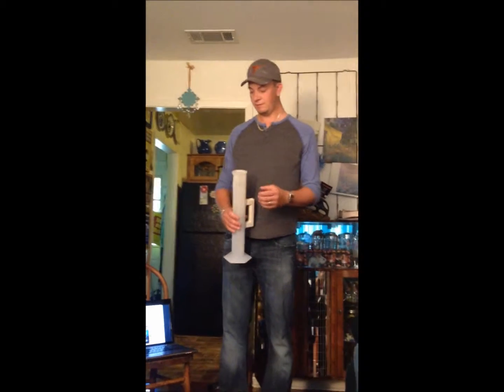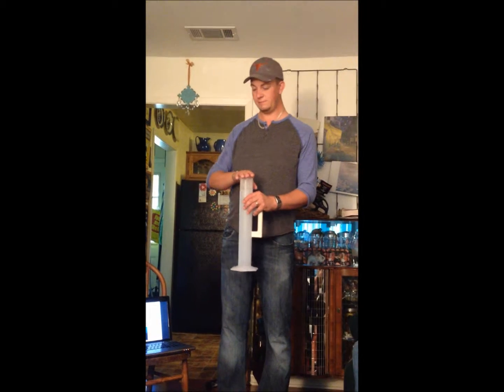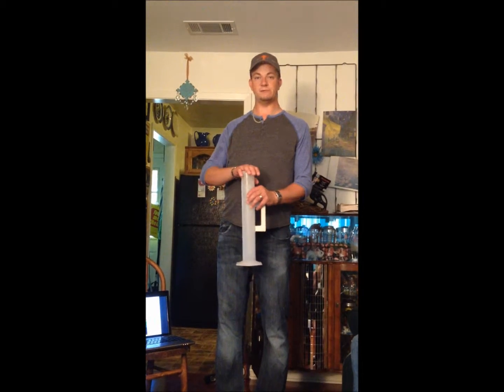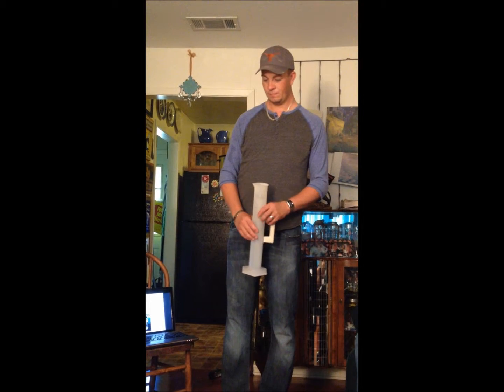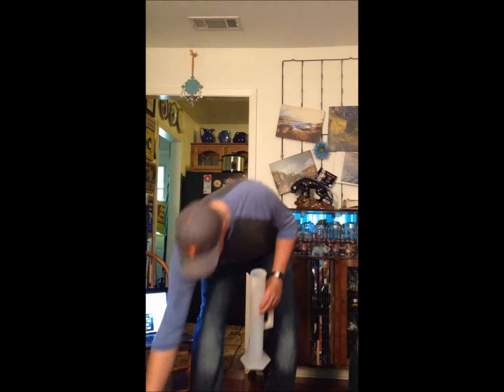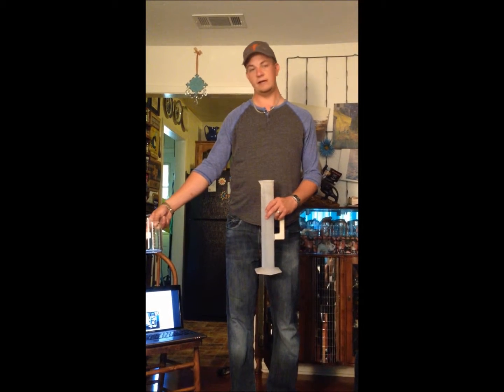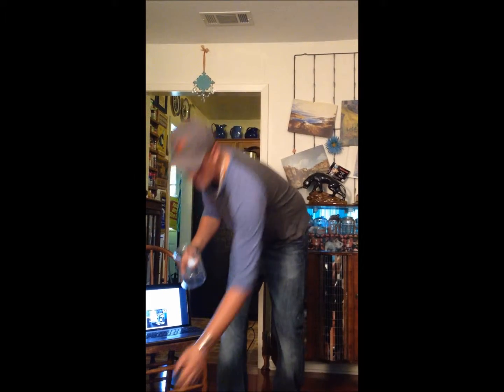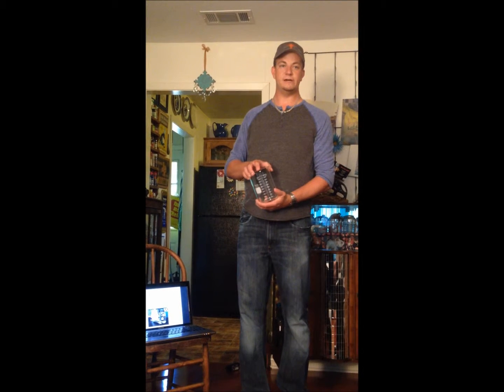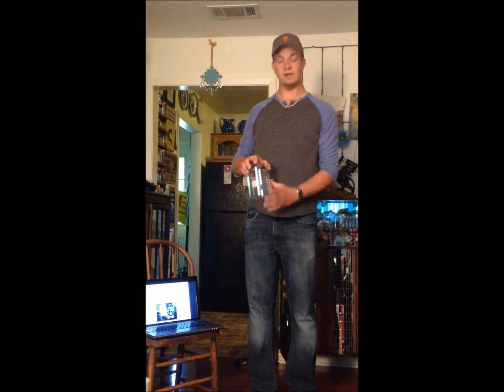You dispense 31.2 milliliters of aluminum sulfate into this graduated cylinder, and then fill it to 1,000 with distilled water, which we make on site, and then put it in this jar here. Then we put this jar under the stirrer and mix it up thoroughly. This stock solution will provide us with a 10 milligram per liter dose per 1 milliliter of stock solution used.